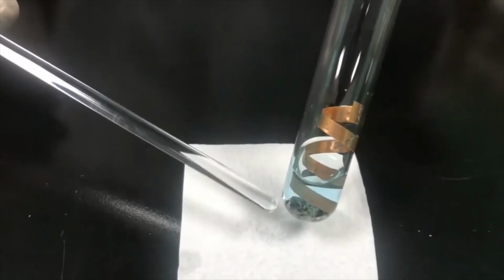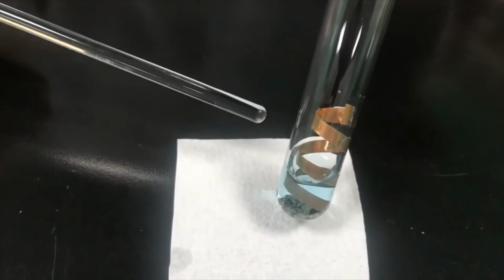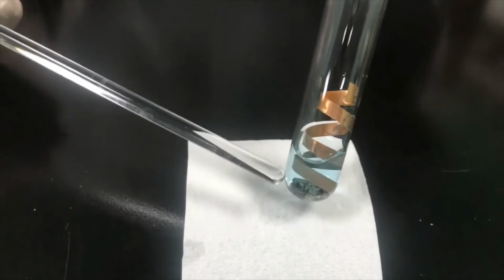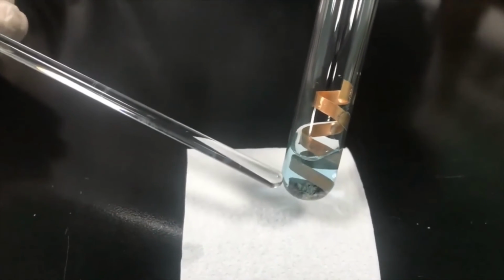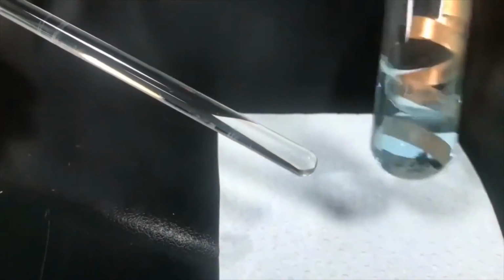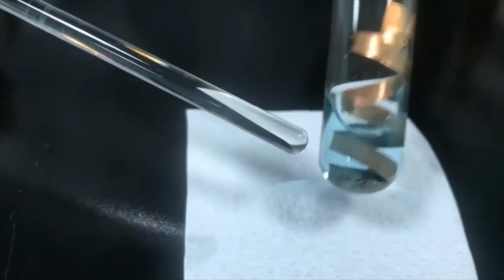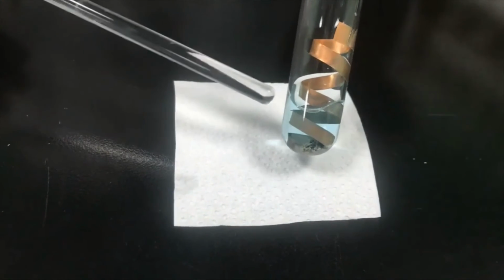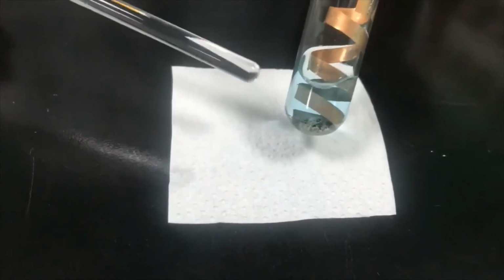This is one type of evidence of reactions. The other evidence is the precipitation of silver element. If I shake it a little bit, you can clearly see the silver there. So here we go, we got the product evidence. You got here silver, and also the copper 2 nitrate is a light blue solution.